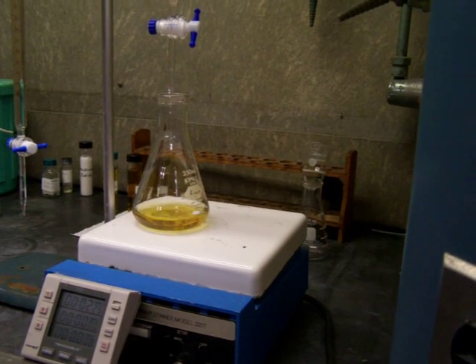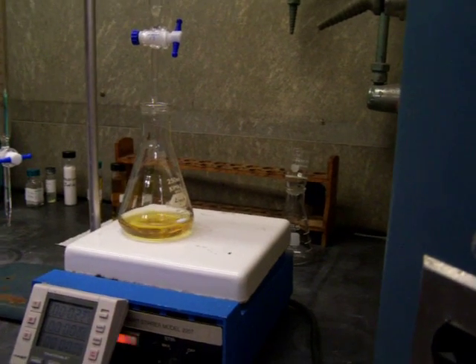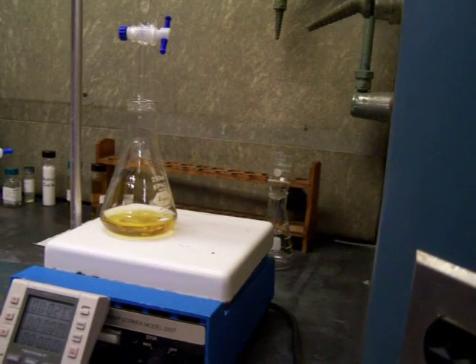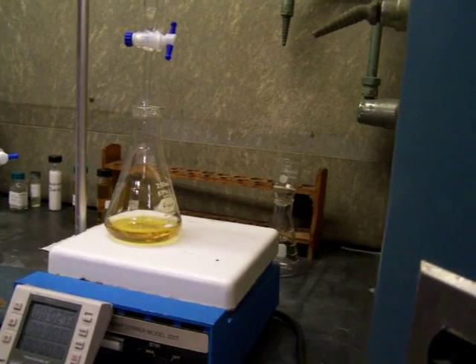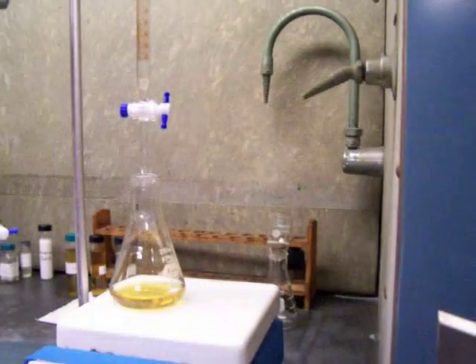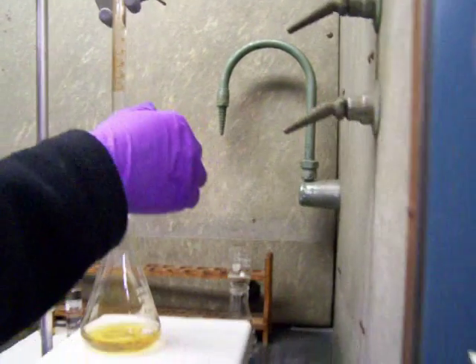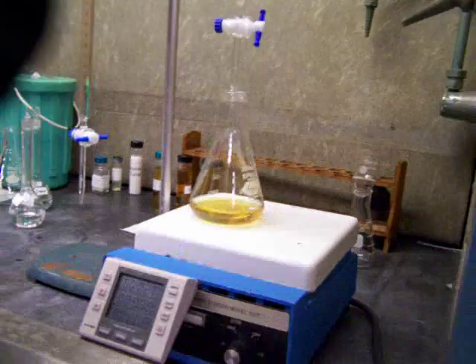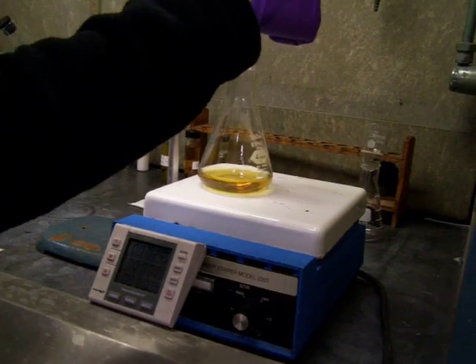And whenever this 3 minute hits, stop the spinning. Right? And then stop the time when the 3 minutes hit. And obviously, close the valve first. Yeah. When you get 3 minutes, stop. What if we run out of fluid? We should close it. It's coming. Wait, you don't want to put more than 10 milliliters anyway. So whenever it hits 10 milliliters, stop it. Or stop the dropping.